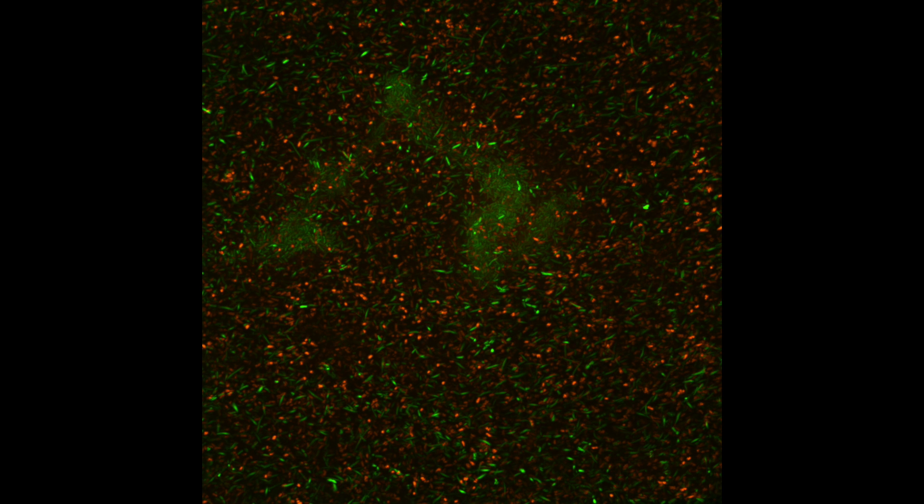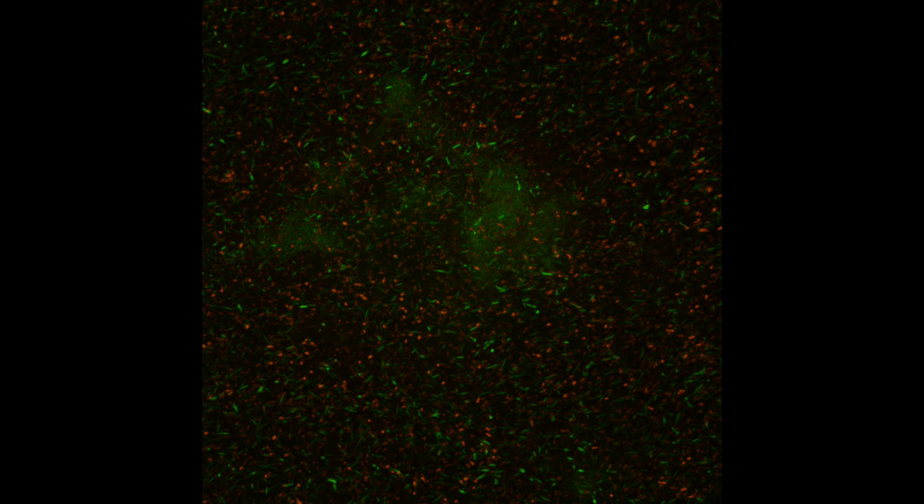If a picture's worth a thousand words, a movie's worth a million words. When you see things on a temporal scale, you're going past or beyond the snapshots, and we're starting to catch biological phenomena that we only really dreamt about before. And now we're actually seeing it happening in real time.